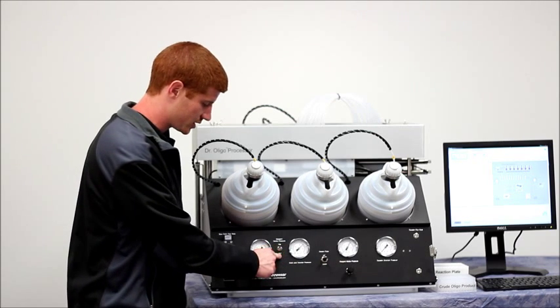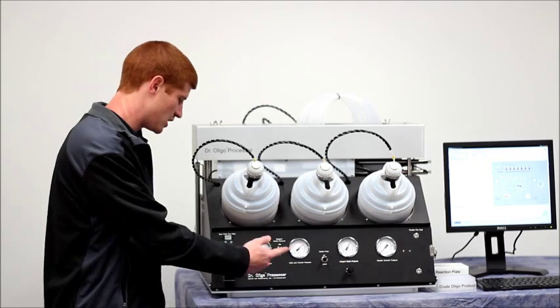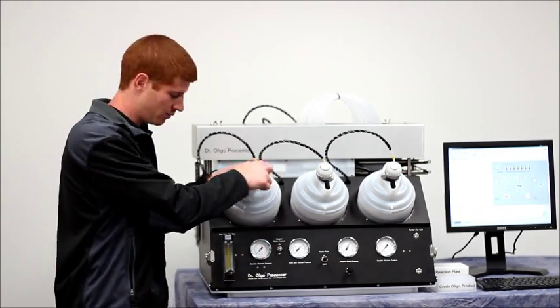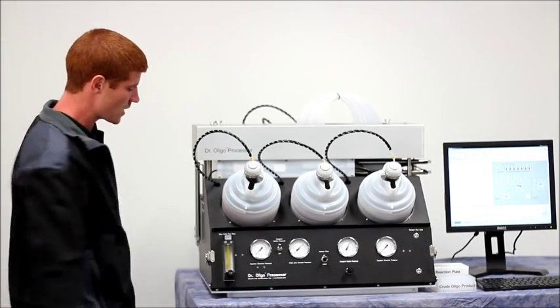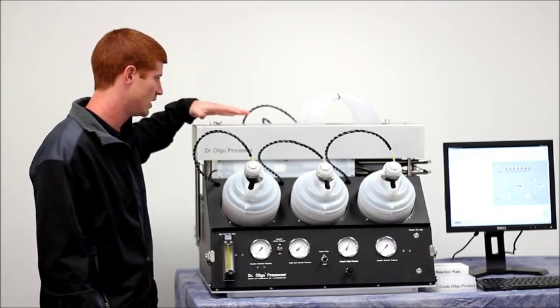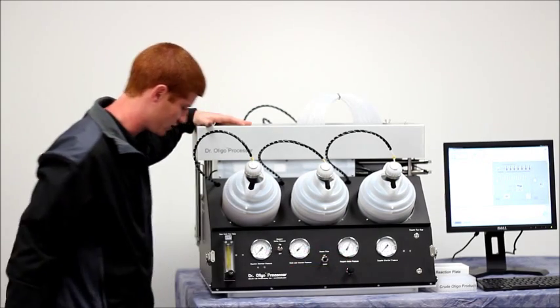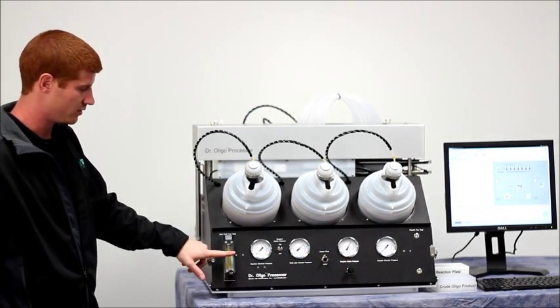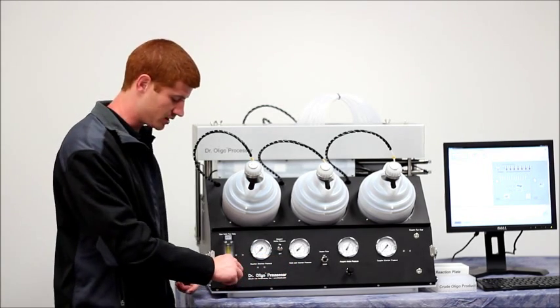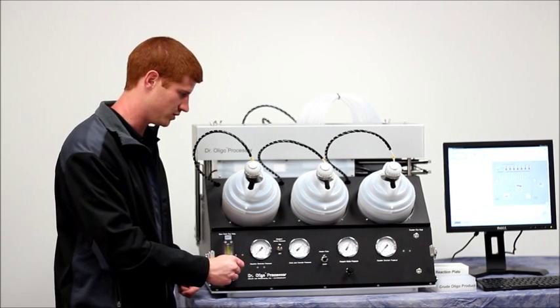The reagent bottle pressure switch controls whether or not the pressure is being delivered to the bottles. An example of how you'd use this was you would switch it off when you're changing a bottle and then back on when you're finished. The reaction chamber pressure gauge just monitors the pressure in the chamber here. So these two gauges are just monitoring and these two are actually adjustable. This slow drain gives you an additional drain as opposed to just this regulator's pressure. You can actually adjust the flow meter down to slow down your reaction speed to whatever you would need.